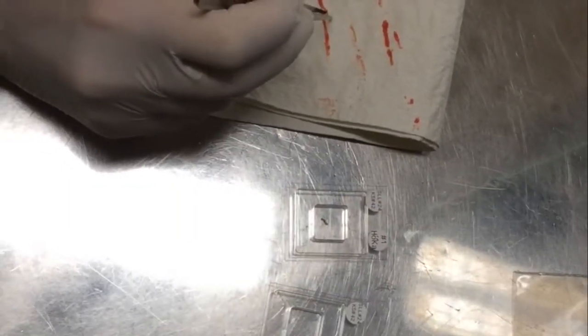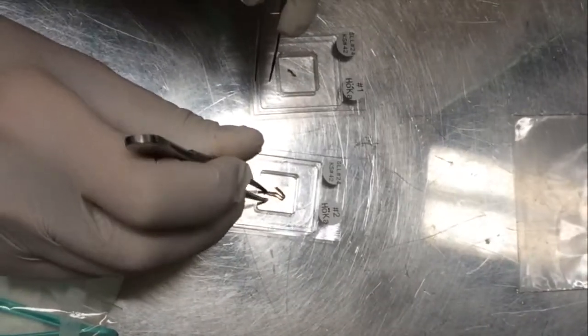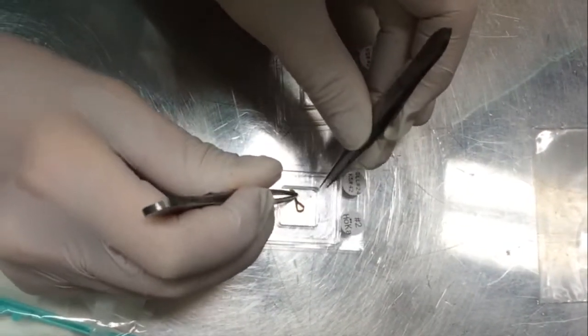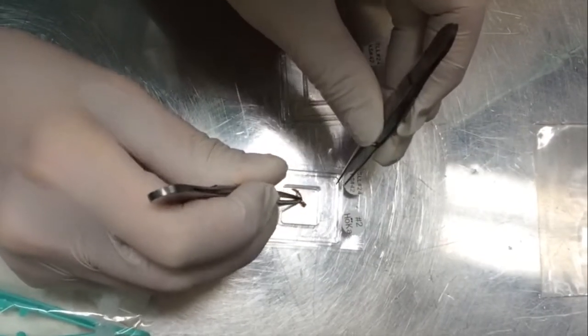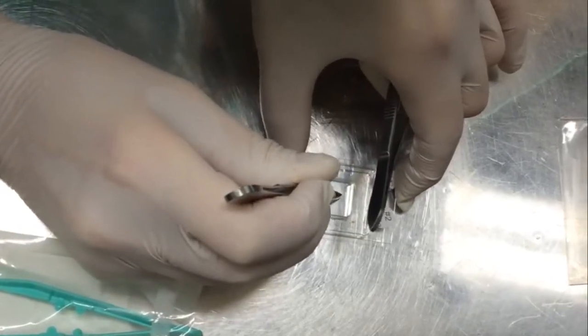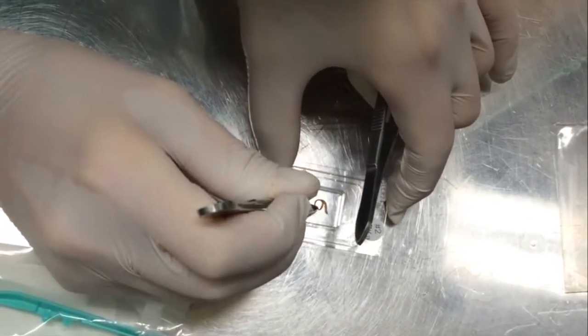The following demonstrates the procedure for needle biopsies. When placing the needle biopsies at the bottom of the plastic mould, try to position the whole biopsy into an area that matches the area of the ST array. Doing so enables the entire biopsy piece to be processed in one single experiment.